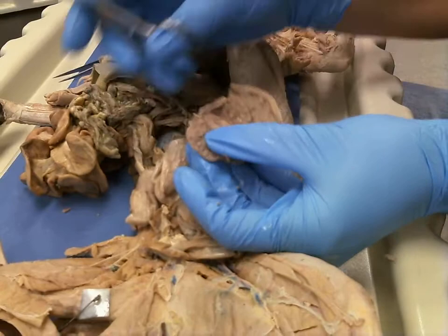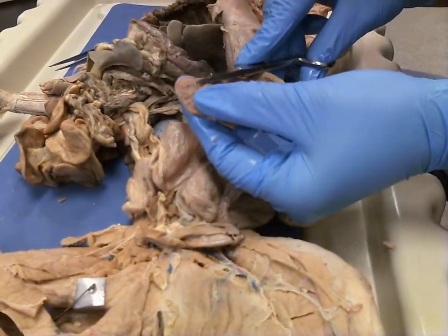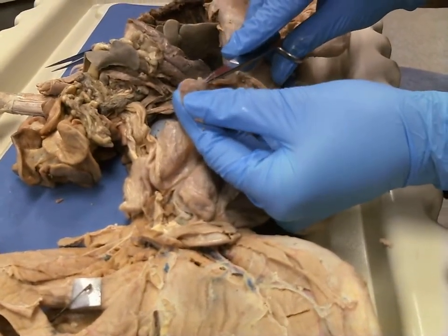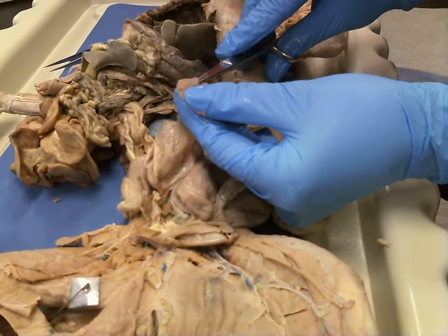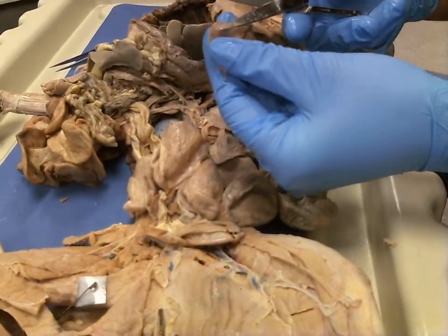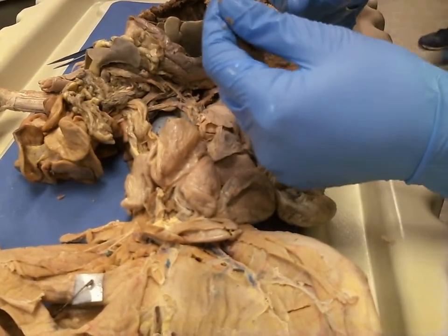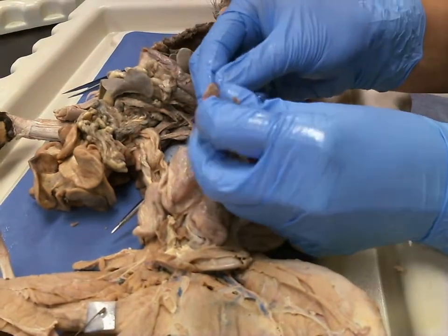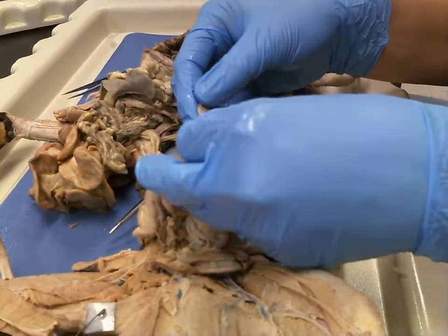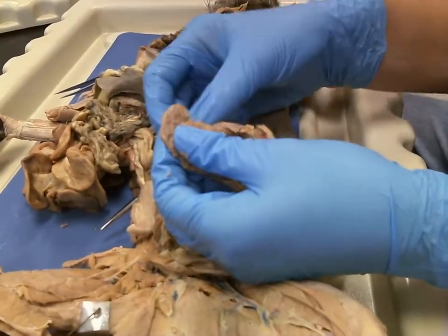You see the fetus is covered with a clear membrane. If we gently dissect that clear membrane off, you can see that clear membrane. That clear membrane is the amnion. In an actual living situation, this would be filled with amniotic fluid. But as we pull that off, you can see really nicely you have a really nice little fully developed fetus right here.